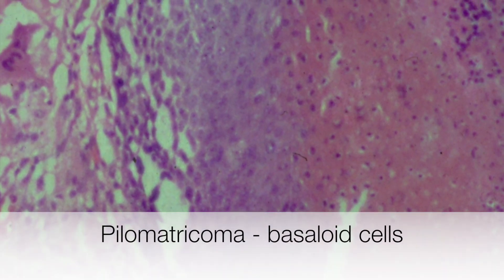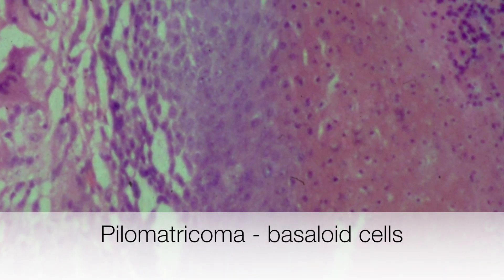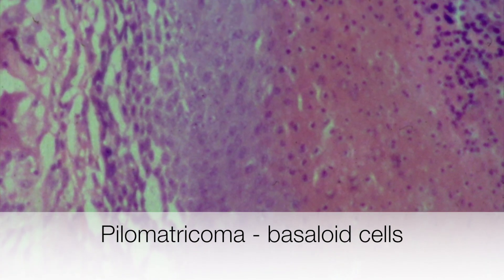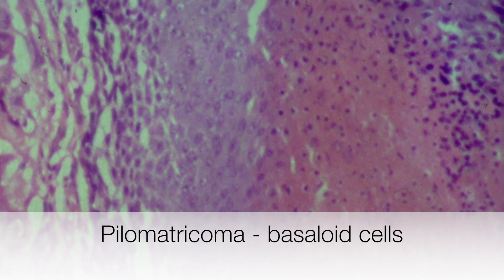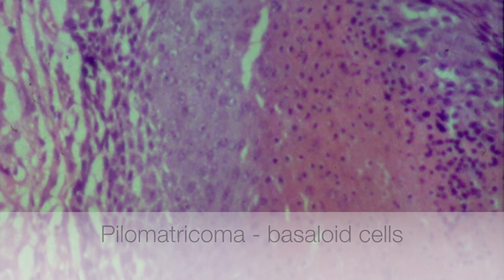Here is another view of basaloid cells that are showing abrupt keratinisation. The basaloid cells have this bluish appearance on the left, and then towards the middle of the picture you can see quite a clear boundary between the basaloid cells and the orange staining keratin.